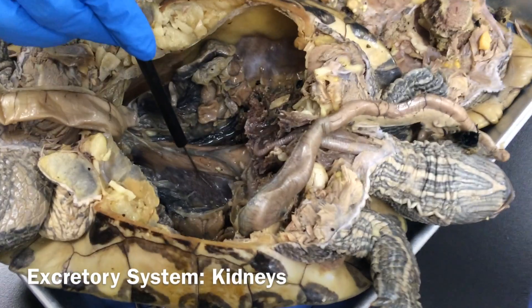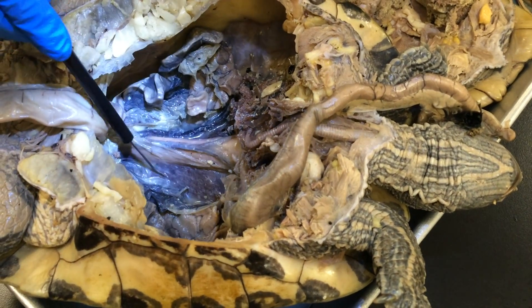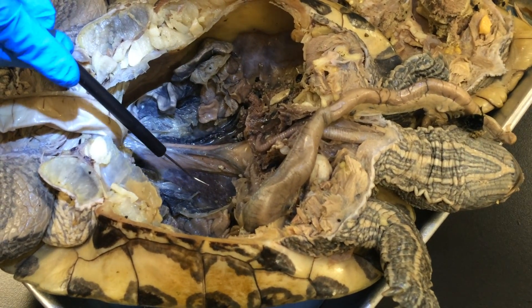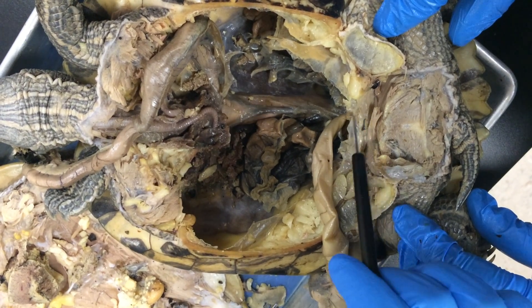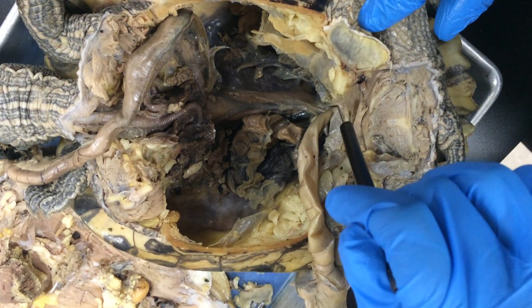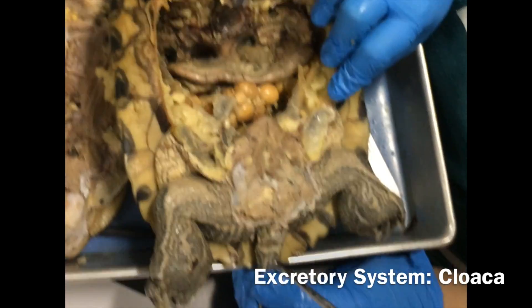Here are the kidneys right along the back — there are actually two kidneys. The kidneys are responsible for removing waste. Reptiles specifically excrete a concentrated waste called uric acid, and this semi-solid substance helps the turtle conserve water. This right here is where the urinary bladder would be. It stores the uric acid and releases it into the external environment through the cloaca, which is right there — that little hole near the posterior end of the tail.